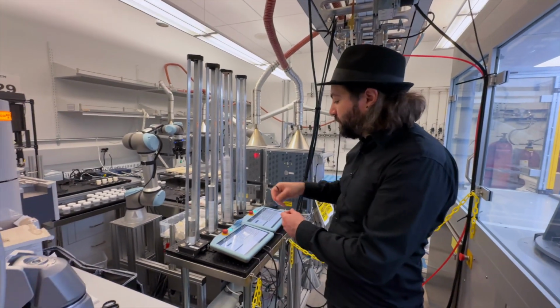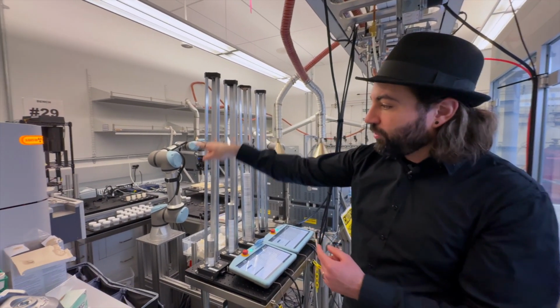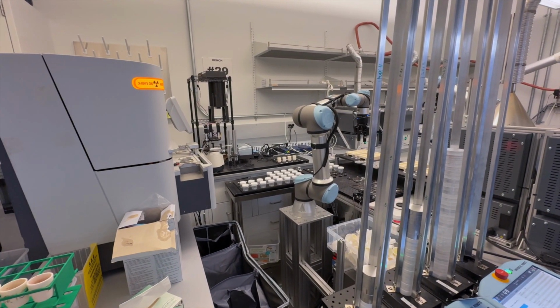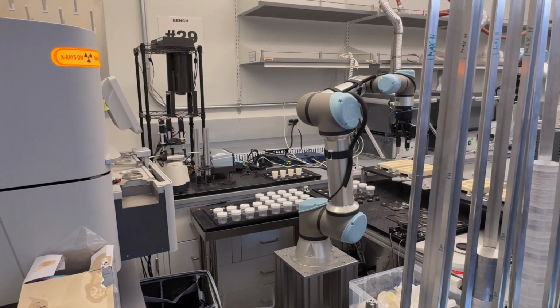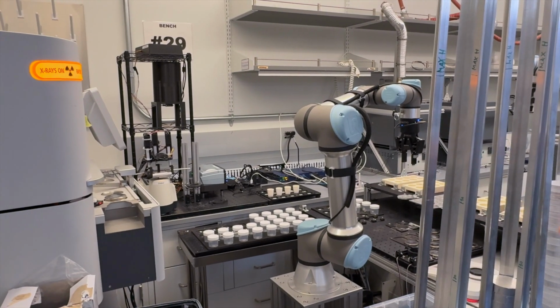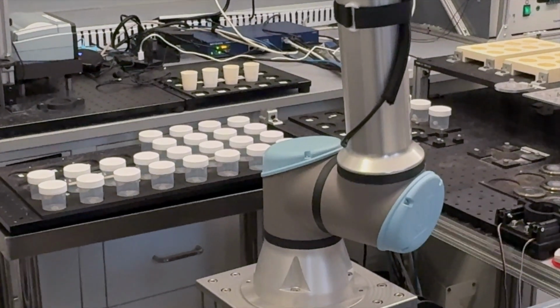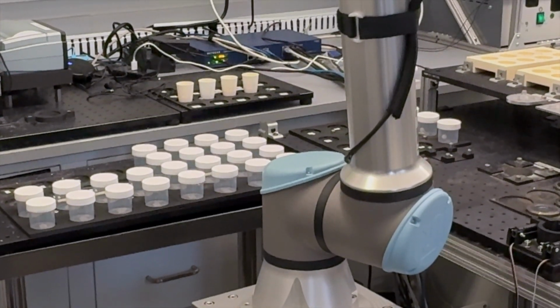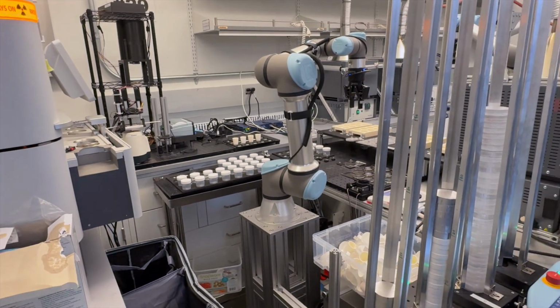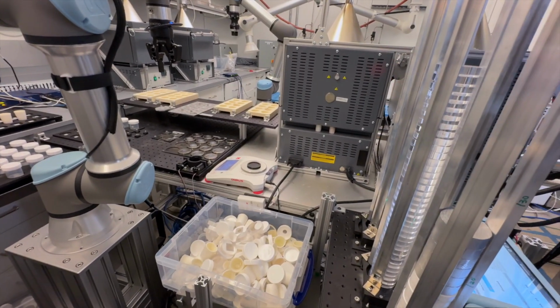And then here, for example, the crucible receives the ceramic ball from that tower, then goes to the shaker. The shaker right there is where the crucible is going to be, shaking this ball inside to grind this material. And then after it is totally ground, we dispense it into one of the plastic containers. And then the plastic containers need to have their cap changed. Some caps have sieves, and that's how we dose the powder onto the disc. And the disc later is what goes to the XRD machine.